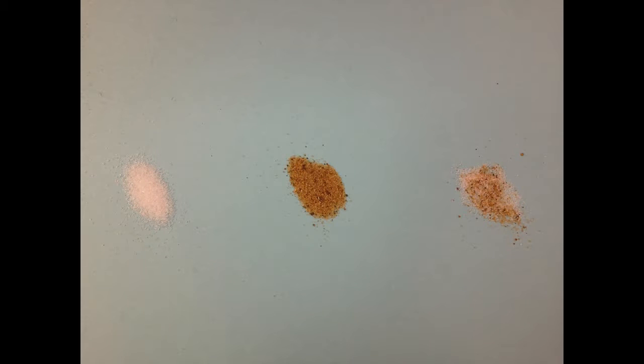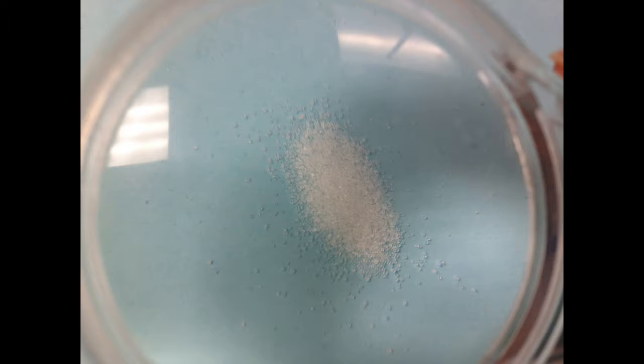So the first section of the lab wants you to divide sodium chloride, or NaCl, sand, and a combination of the two together into three different sections on a piece of paper. Here I have them laid out. Next we will examine them with a magnifying glass. Here is the sample of NaCl, or sodium chloride. Please jot down any observations and make sure to draw a picture in a third of your particle picture box.